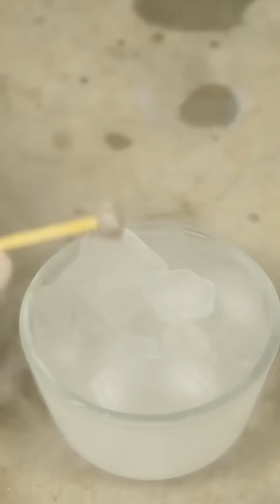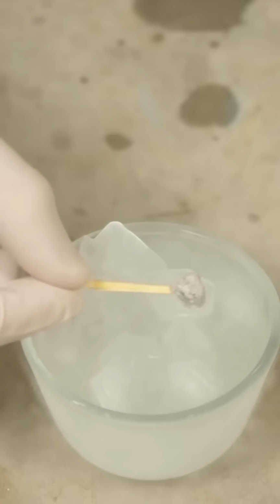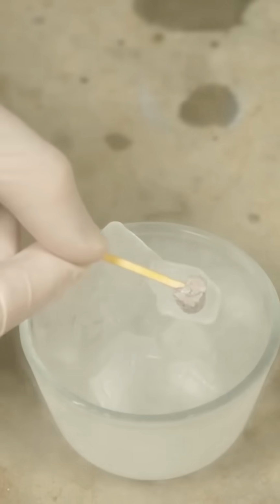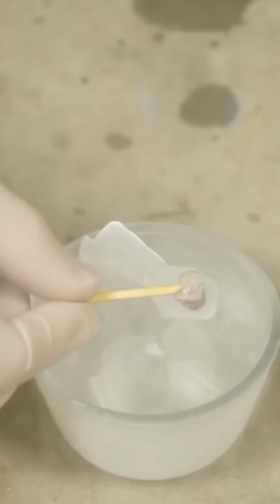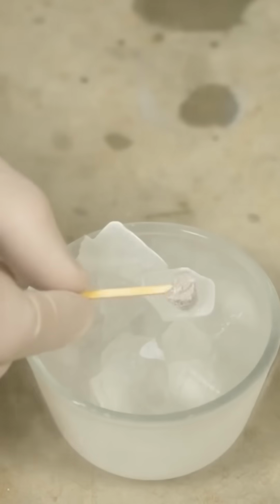Okay, so you can see that when I'm touching it to the bare ice on top here, there's no reaction whatsoever. That's because now there's no layer of liquid water on top of it. And if there's no liquid water, then the sodium cannot react.